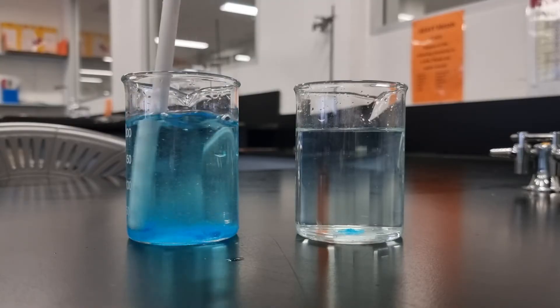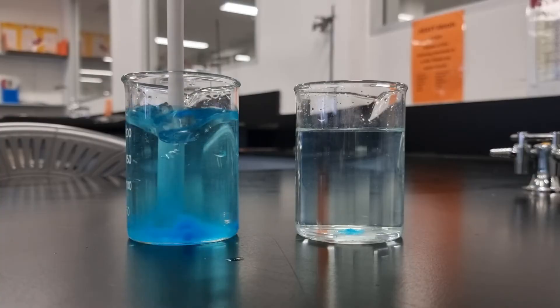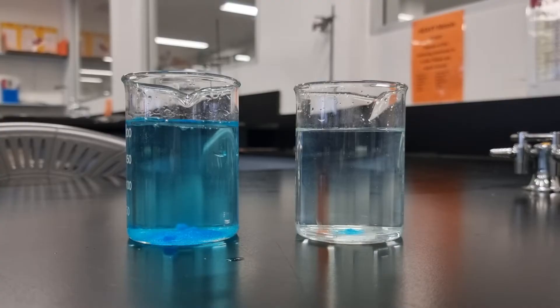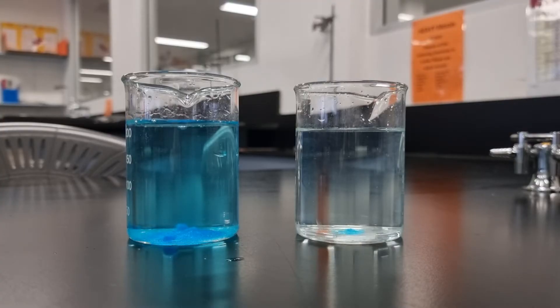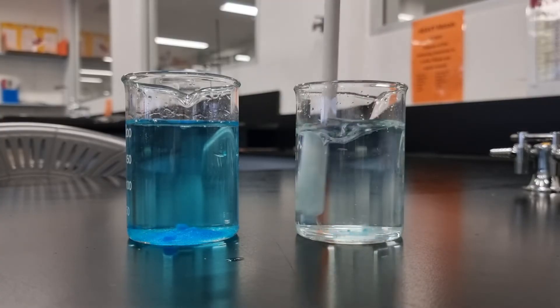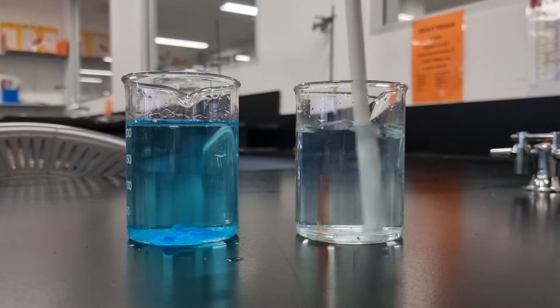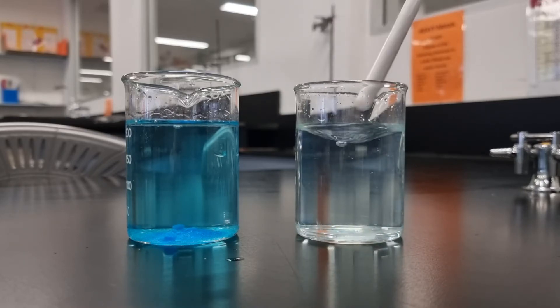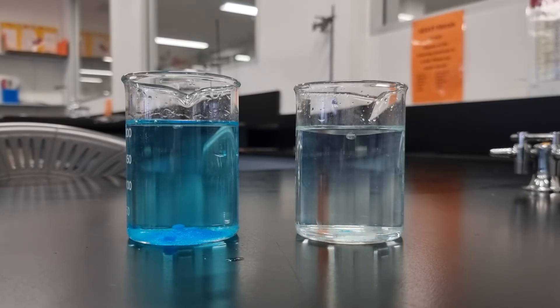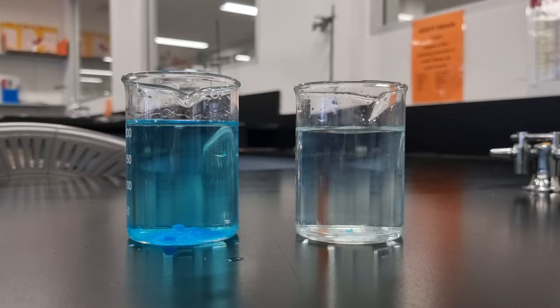So the definition of a dilute solution is one in which there is not much solute dissolved per unit volume. I didn't have much copper 2 sulfate for the amount of water that I had, and so that's why we only get a very faint blue colour, which comes from the copper sulfate dissolved. But there isn't much copper sulfate there so it's not very blue.